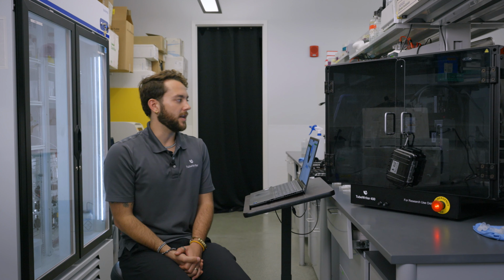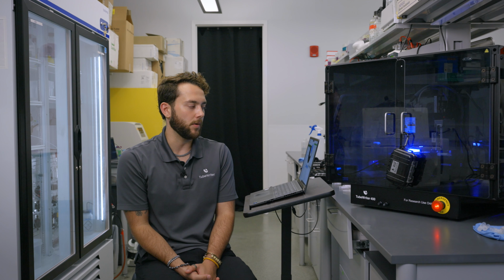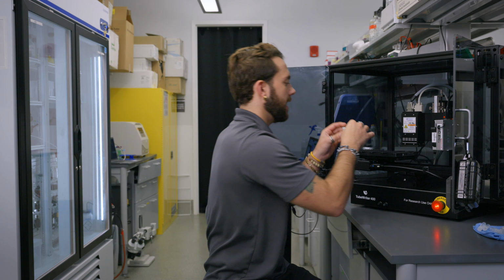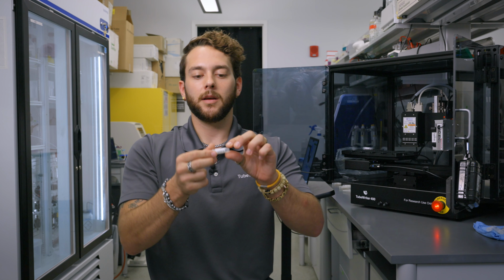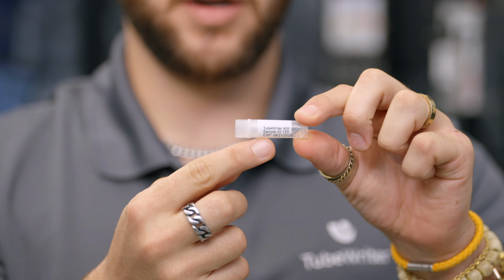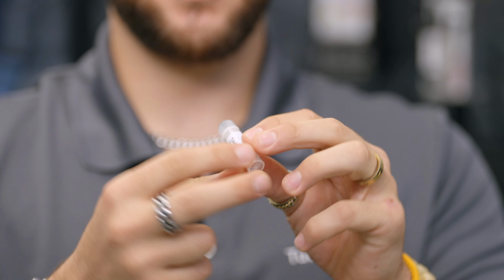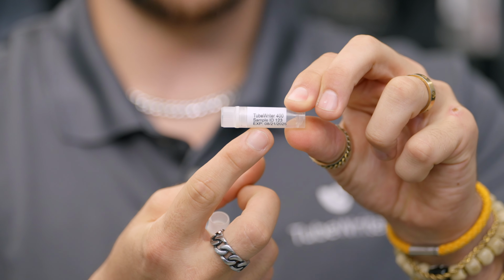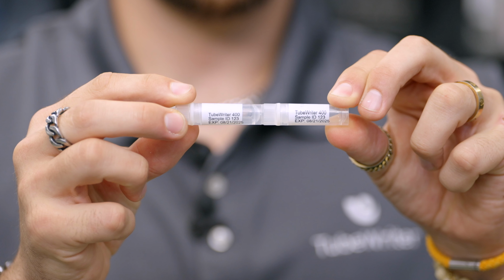And now it's going to print, and we'll compare it to how we just printed and how it looked then. So it's done printing. I'll open up that safety cage and check it out. Here's that last tube, and if you remember correctly, on the last print job we did, that last line of text was a little bit stretched out and kind of warped. This is the 50th tube after we made those adjustments, and now that last line of text isn't as stretched out and warped. And here it is for a side-by-side to compare the two tubes.